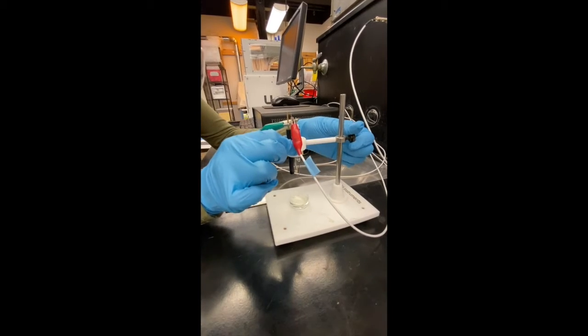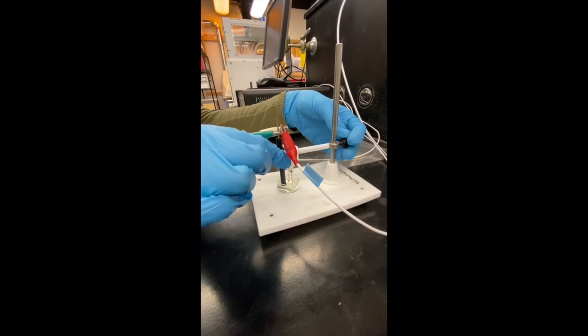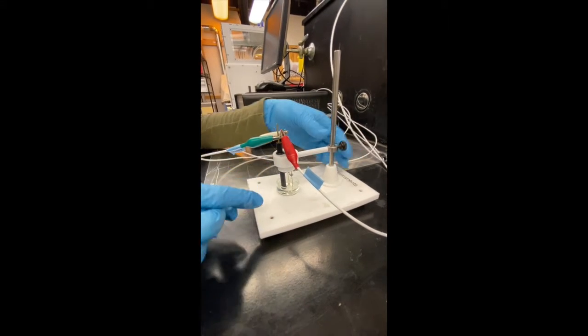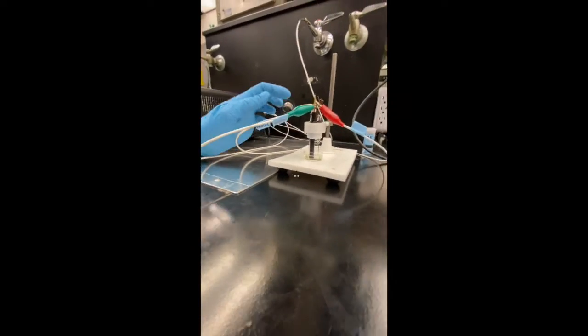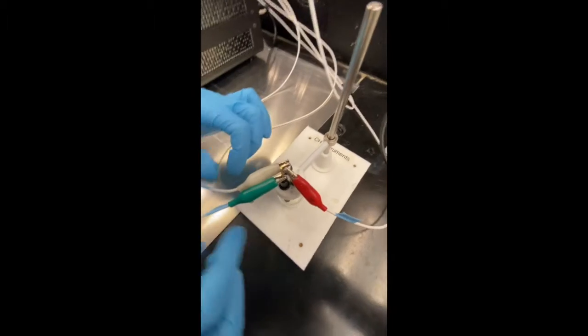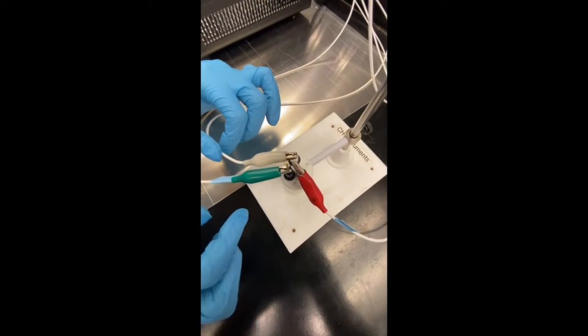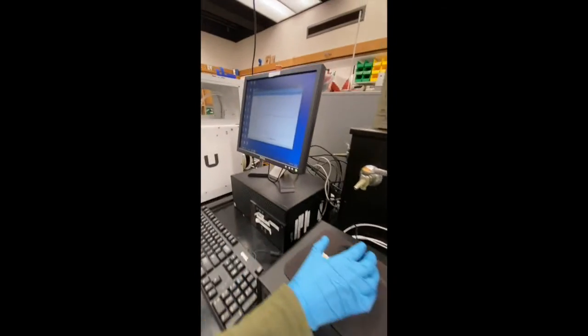And we're going to lower our electrodes into the cell. Again, I'm going to double check that all electrodes are immersed, that there's no contact between them at the bottom or the top here. That looks good to me. So now we're going to come back over here to our computer.